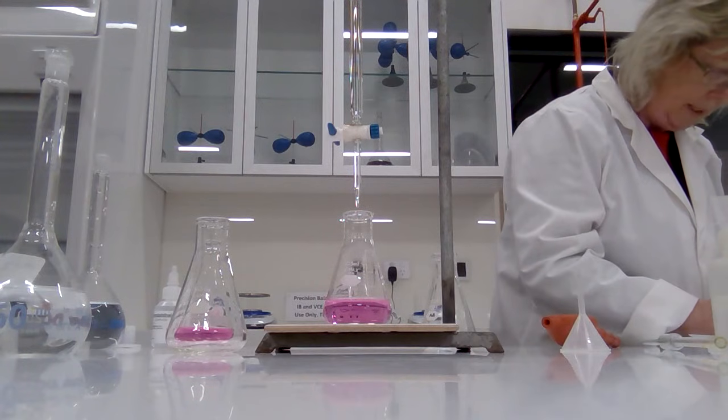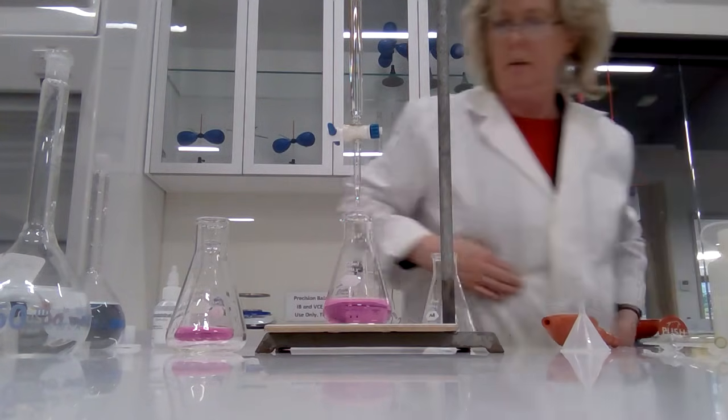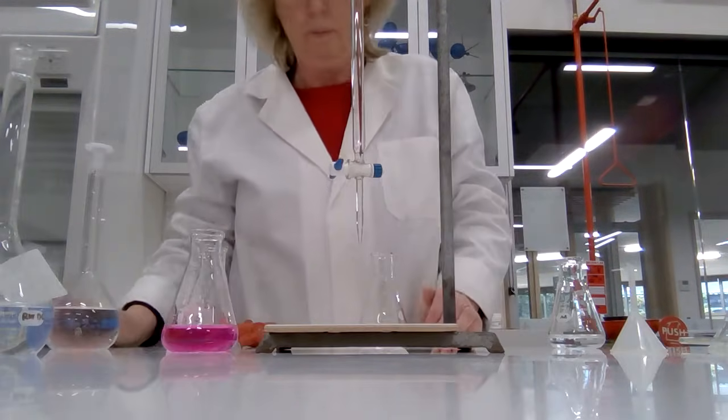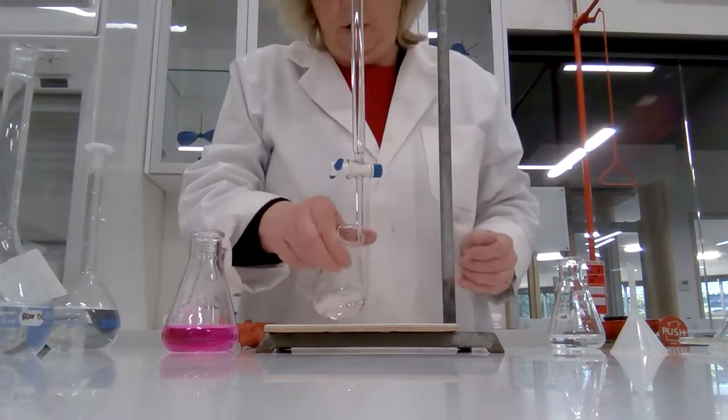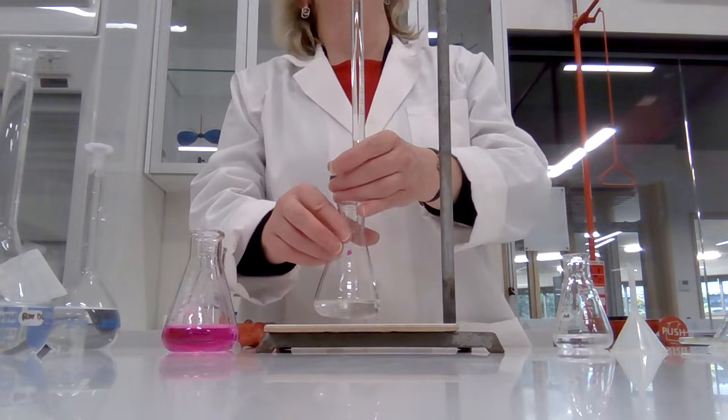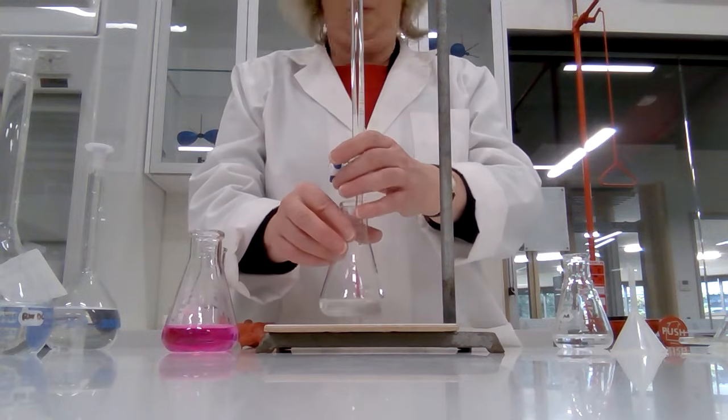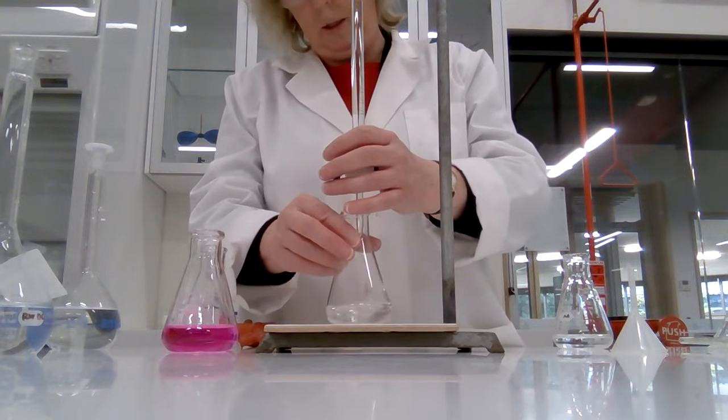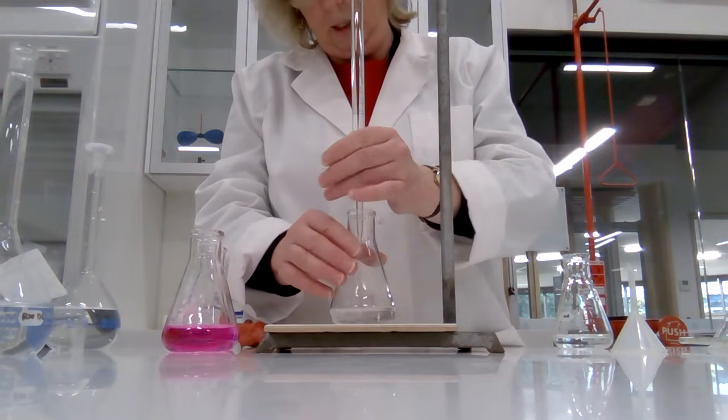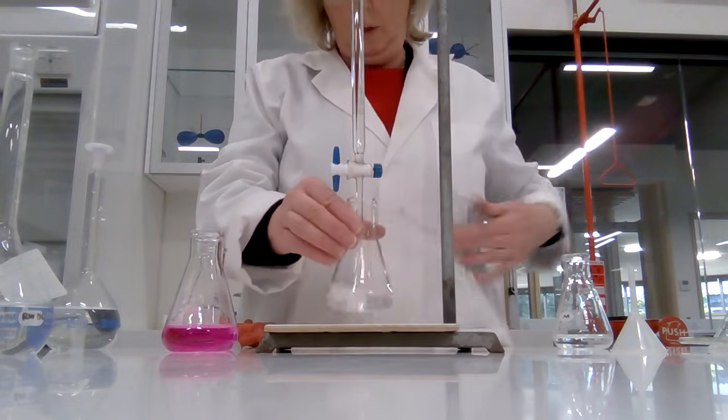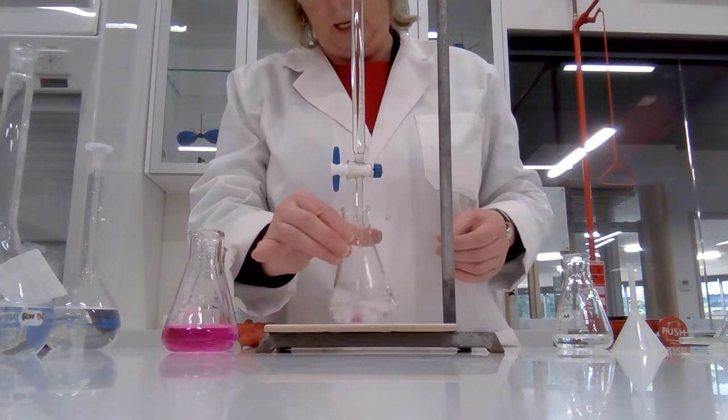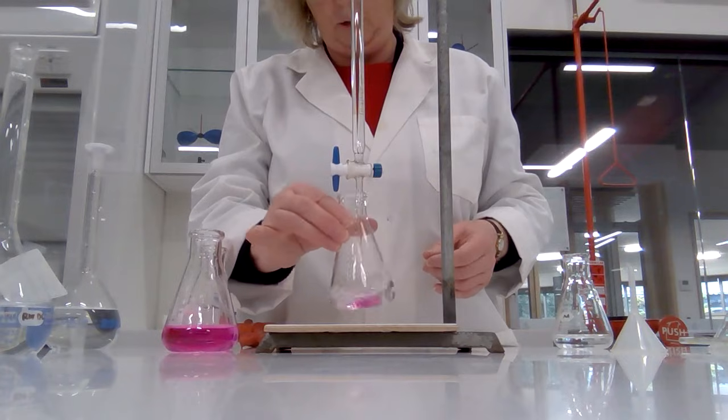That's quite a pity. So let's just refill our burette. Our third titration. Got my phenolphthalein in the oxalic acid. Starting volume was 0.15 milliliters, so away we go. If our burette will work, come on burette, please, thank you. So this burette has a habit of coming undone while I'm trying to use it, which is not great.